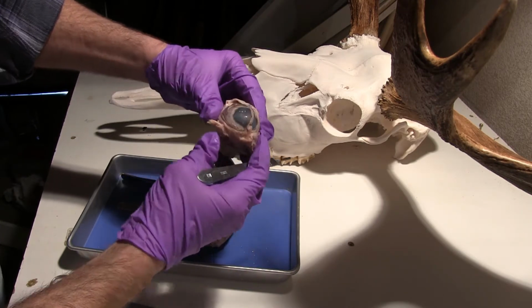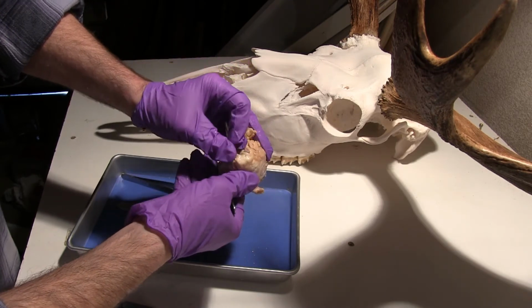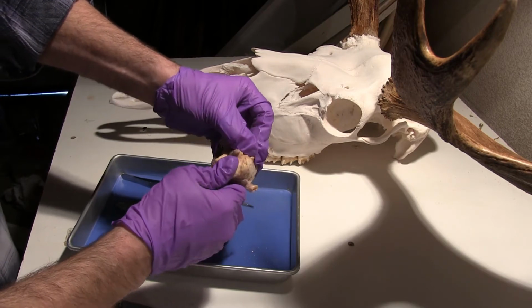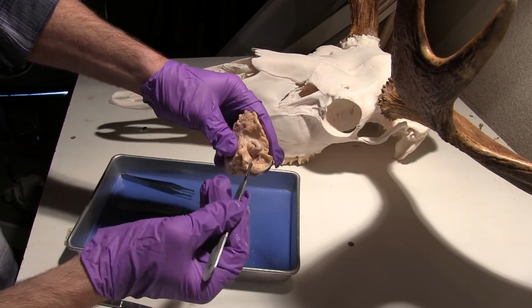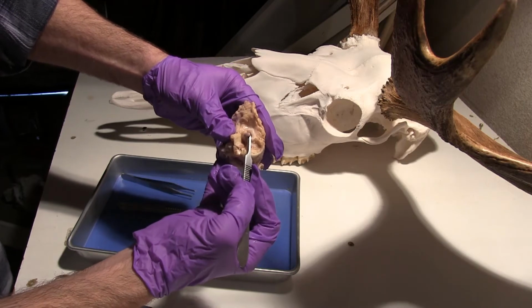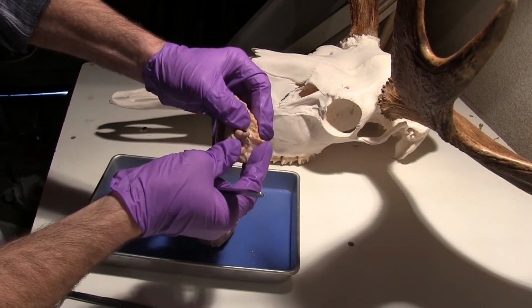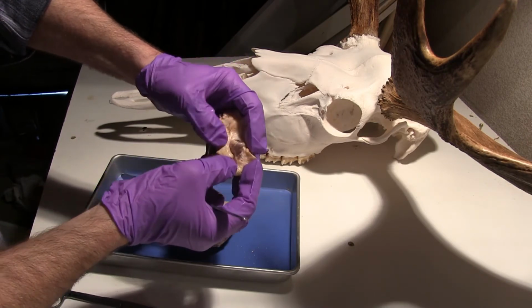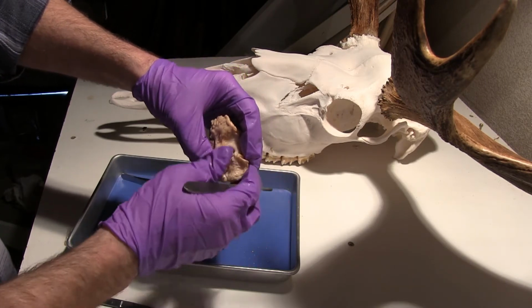So then moving to this posterior portion here, we're going to look for a different tissue type again, and I can see that adipose tissue. This is a good demonstration of what the adipose tissue feels like and looks like, but then I see this little nerve right there, and that's actually going to be the optic nerve. So that is what's going to transmit signals, the beginning of our sensory pathway for vision. The optic nerve is going to connect to the optic disc inside the eye.